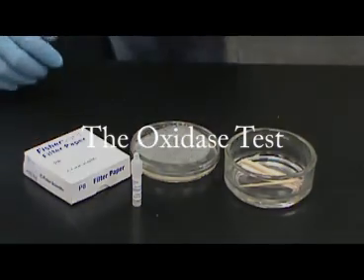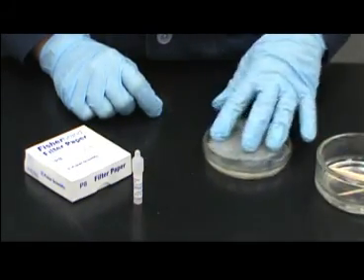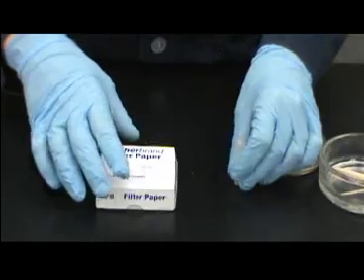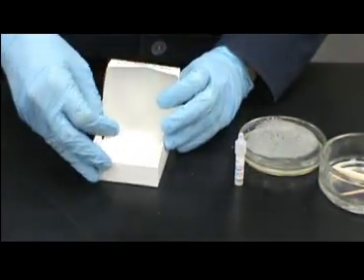The oxidase test. The oxidase test detects the presence of cytochrome C oxidase, a cytochrome enzyme used in the reduction of oxygen in the electron transport chain in aerobic cellular respiration.